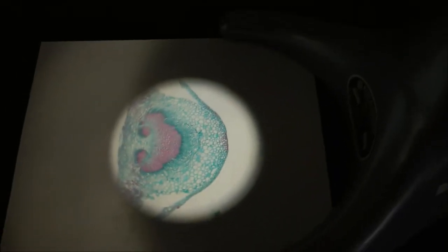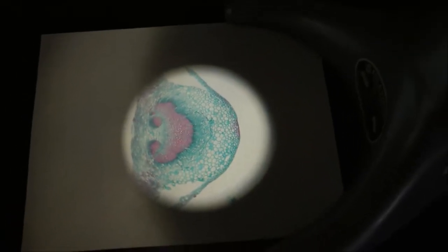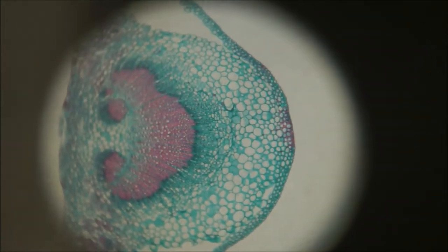The microprojector may be used in a lighted room or in a darkened room depending on the nature of the specimen being looked at.